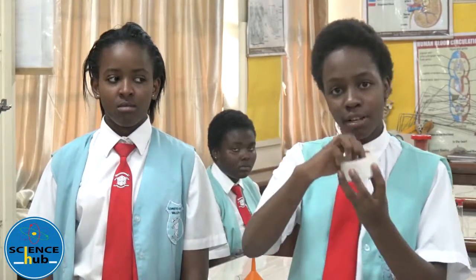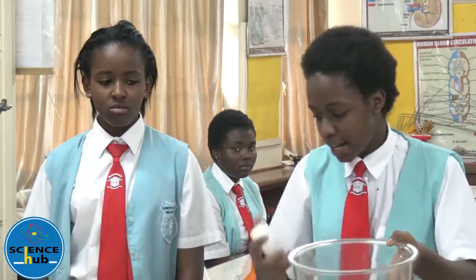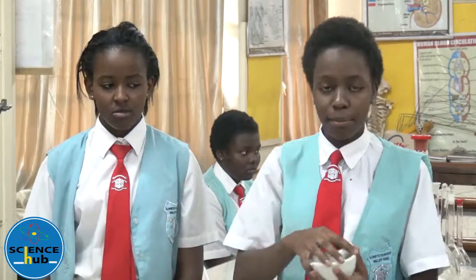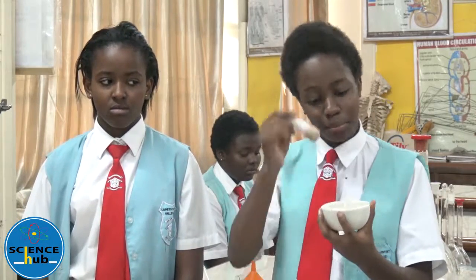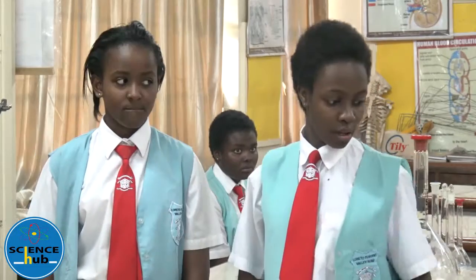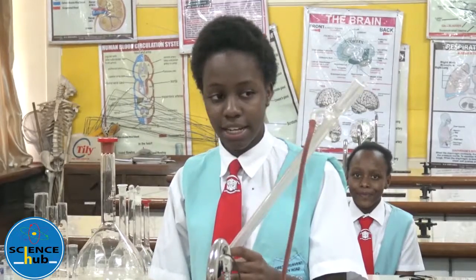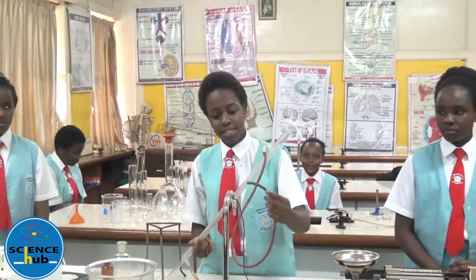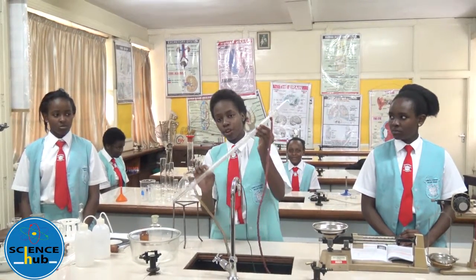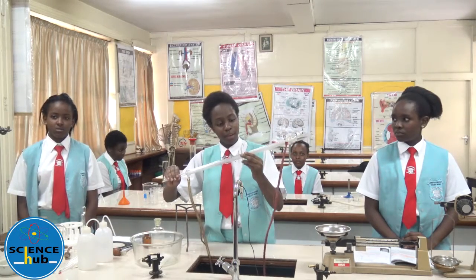This is a beehive shelf. It is placed inside the trough when you are trying to collect a certain gas inside a gas jar. This is a pestle and mortar and it is used to crush substances. This is a Liebig condenser which is used to help gases condense back into the liquid state. You put one side of the Liebig condenser into the tap and the other side into the sink. Water flows through the outer layer of the Liebig condenser and cools the gas, helping in the process of condensation.